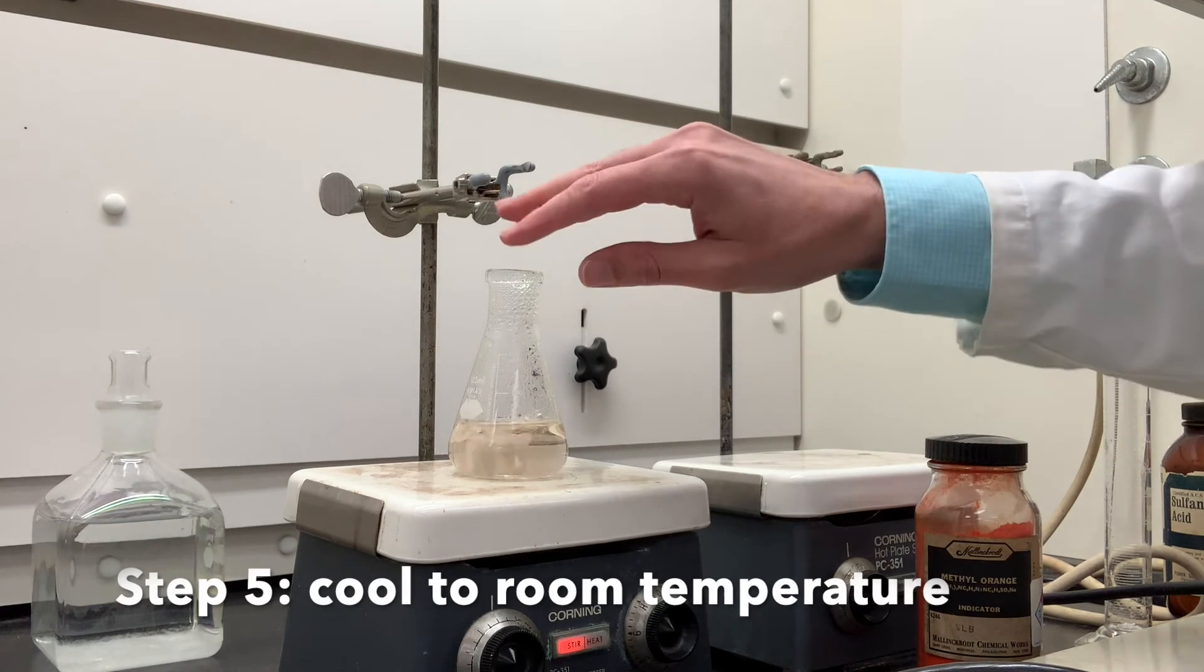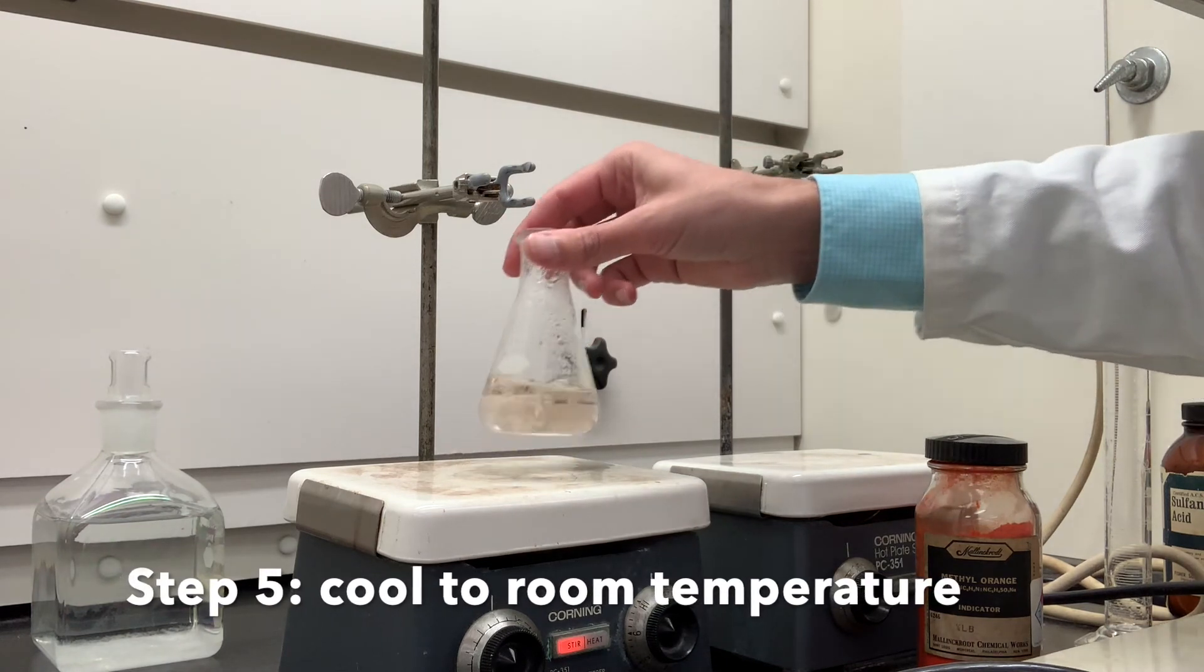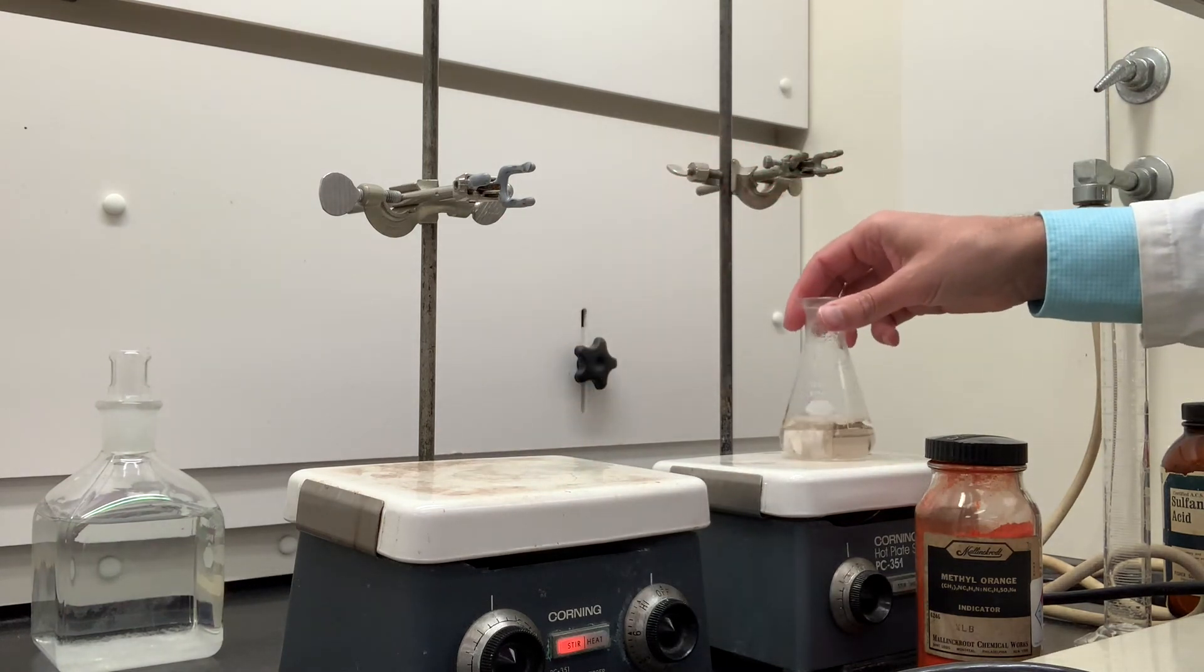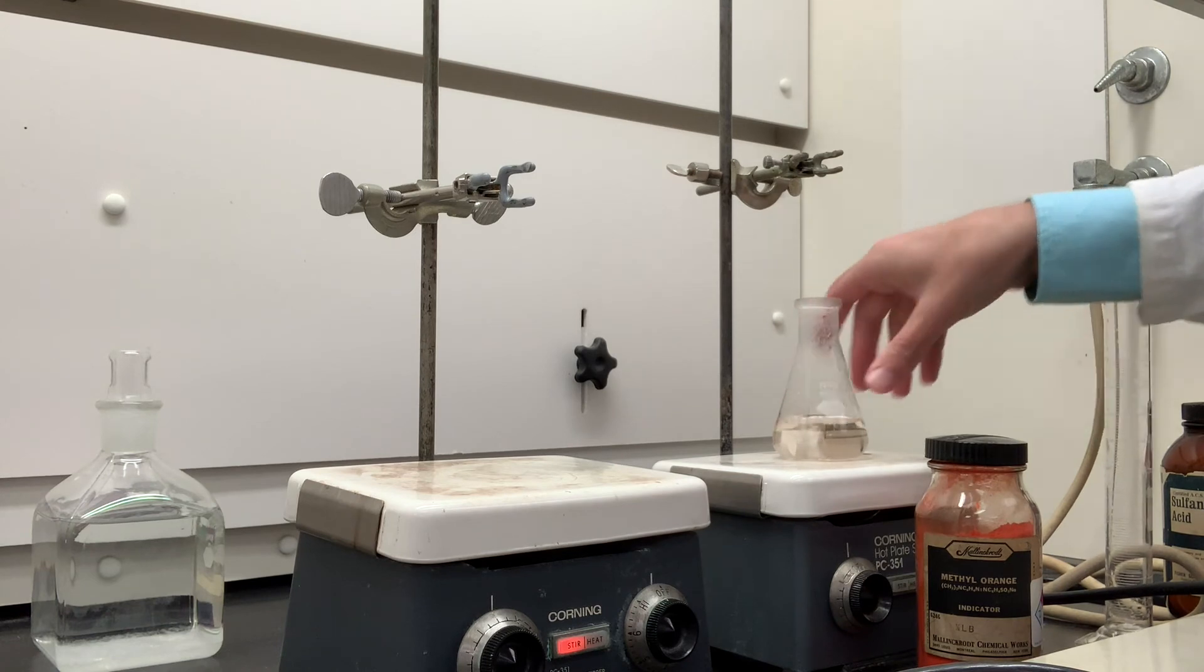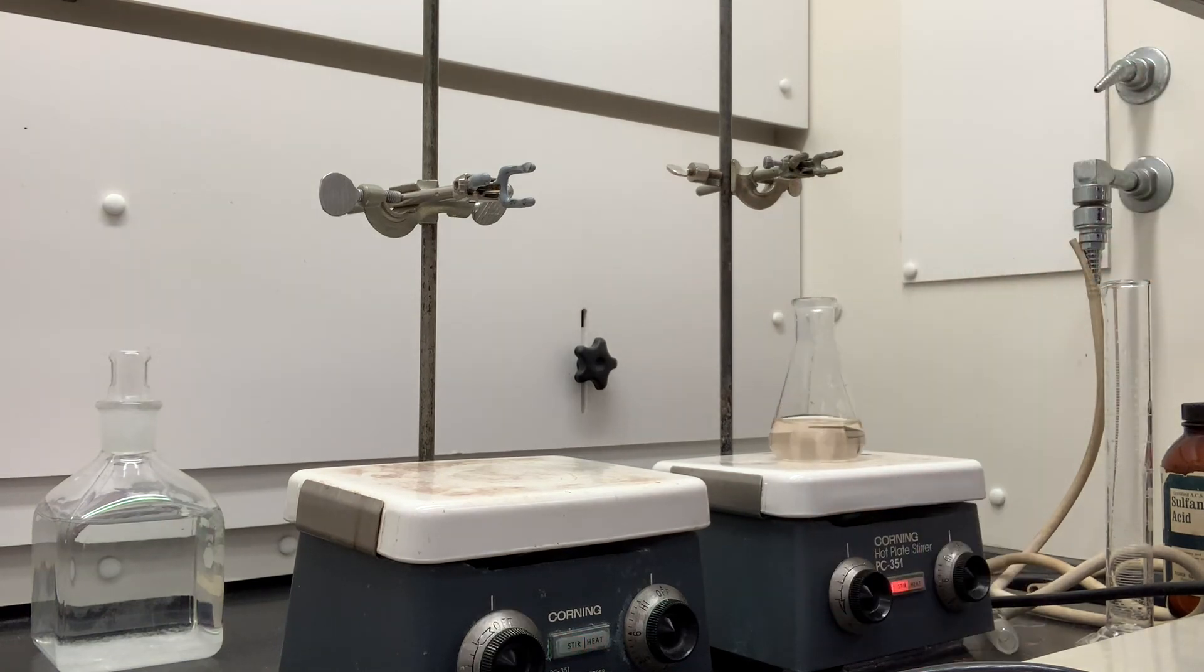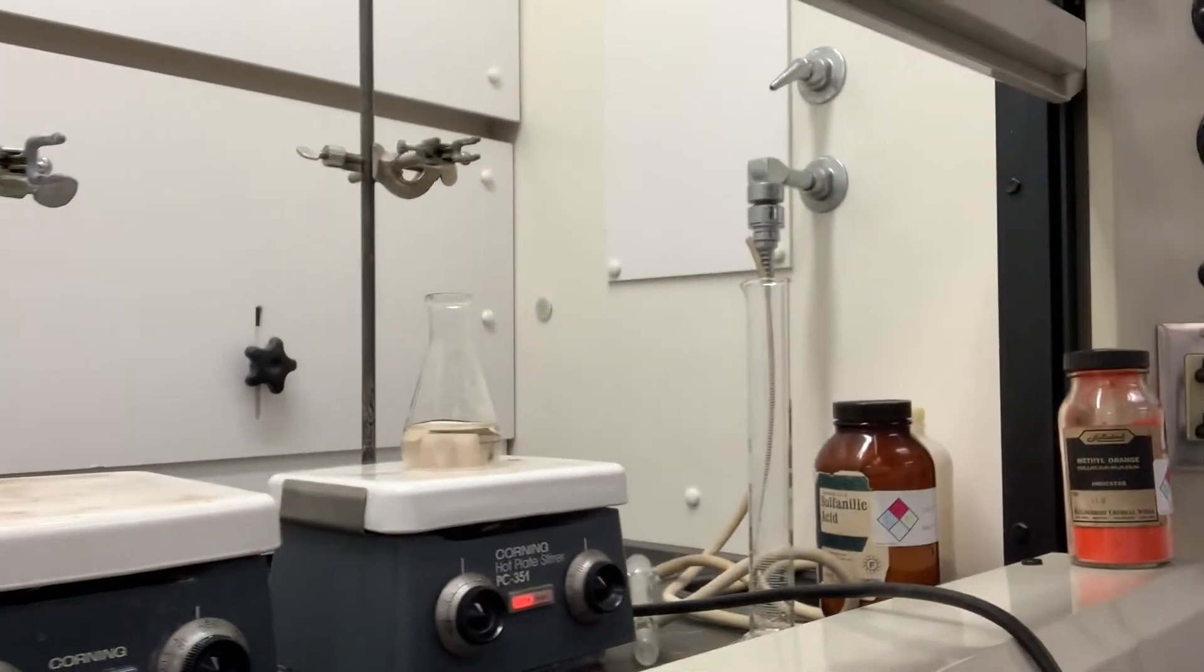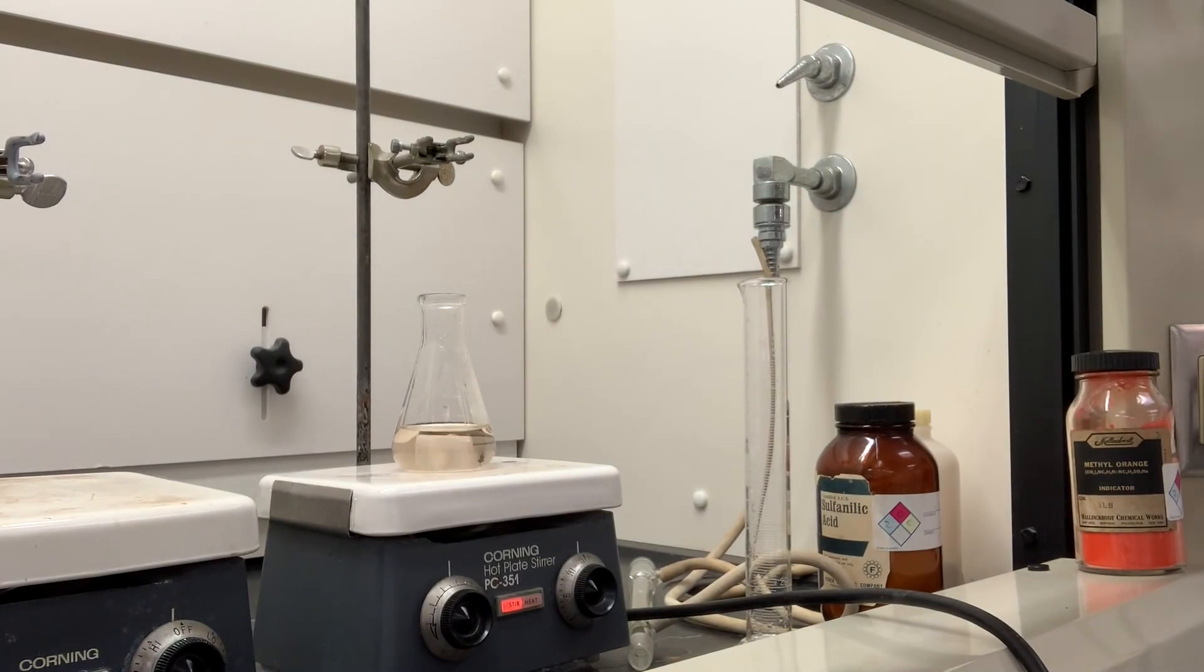Now that this has dissolved, we want to cool it to room temperature. I'll do it over here so you can see that. We have our cooled mixture there. This is the conclusion of part one.